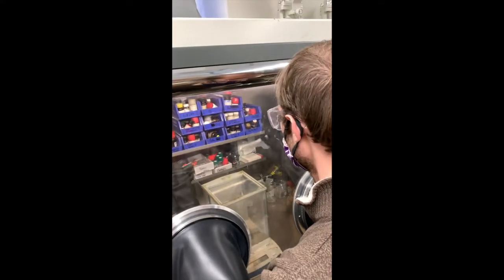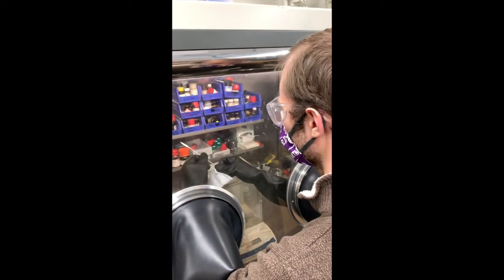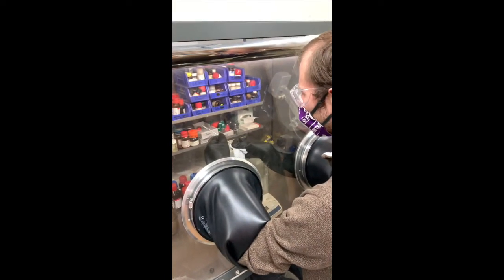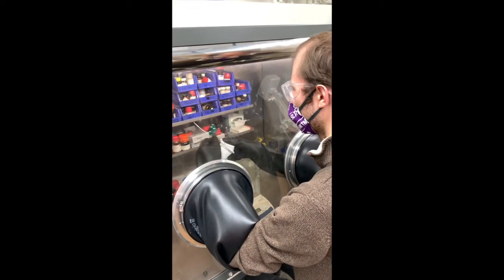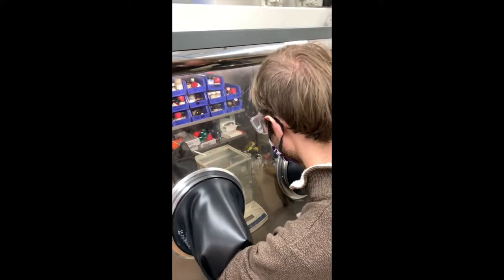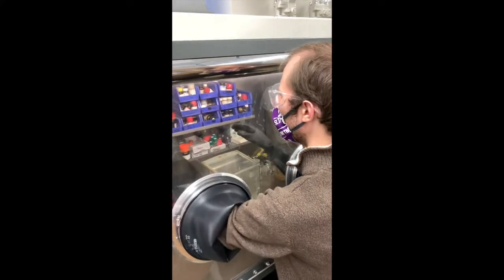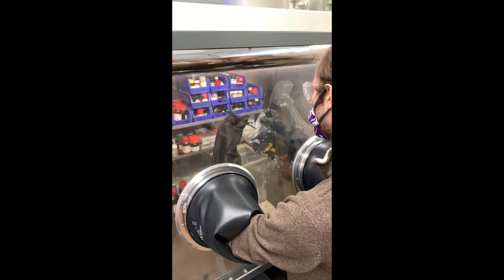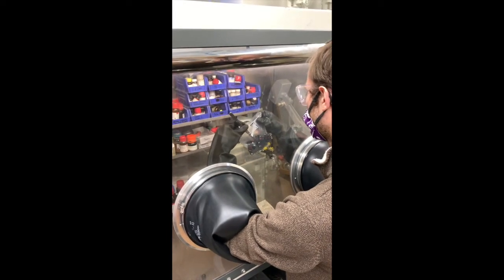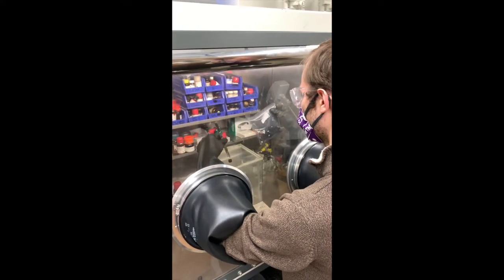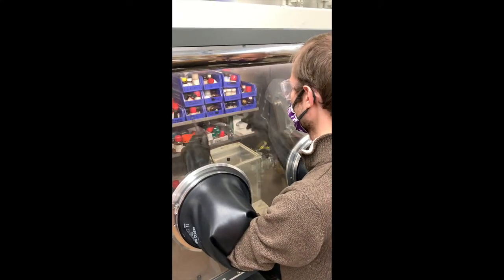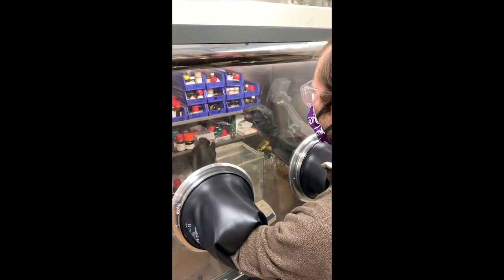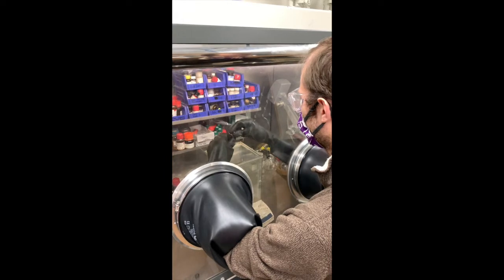So we'll put that back. And it's a good practice to wipe off any type of spatula here that you soiled. Because you never want to assume, unfortunately, that somebody's done this before you, even though they probably have. But it's a good idea to just wipe that down so that it's ready for the next person. And so we're going to bring out our vial here. I'm going to grab my tongs, grab a brand new cap, which we almost always have bags of these caps in here. Right here on the shelf. And these Teflon caps form a really nice seal.